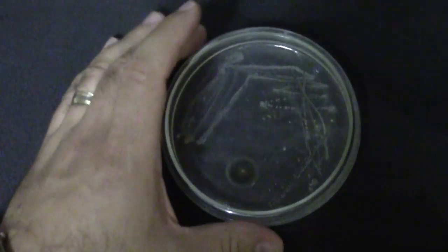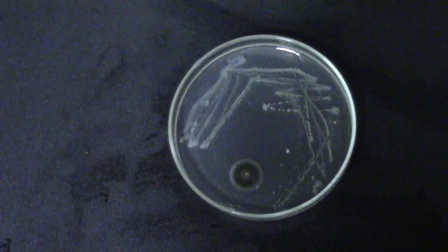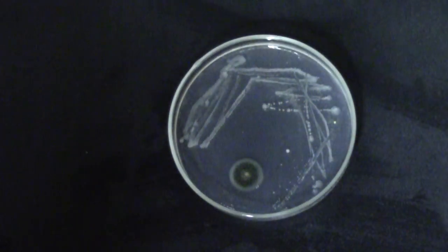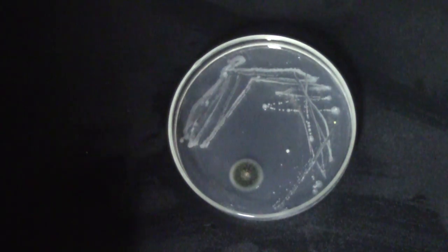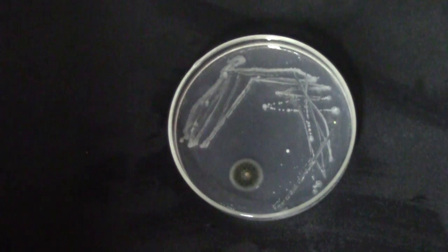Now if you've watched my aseptic technique video I told you you probably shouldn't talk while you're streaking yeast or working with yeast and this is why as you can see right here a nice fuzzy colony of mold that probably came out of the spit when I was talking so you know as a rule you don't want to talk when you're streaking.